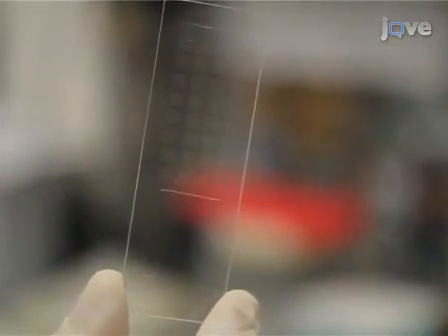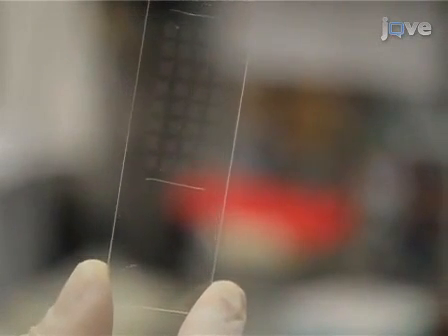The quality of microarray fabrication is one of the most critical factors for the success of a microarray experiment.